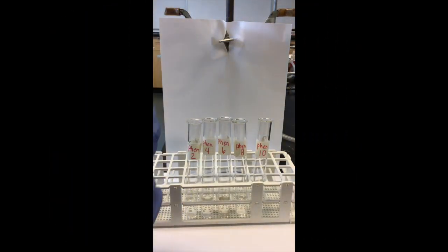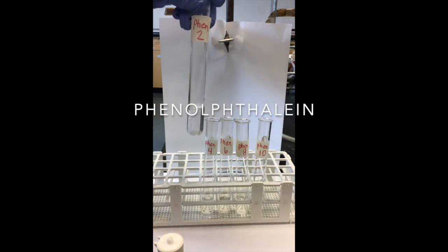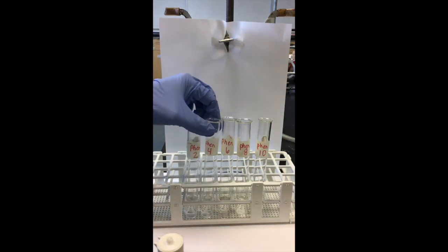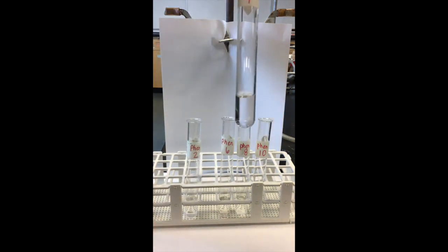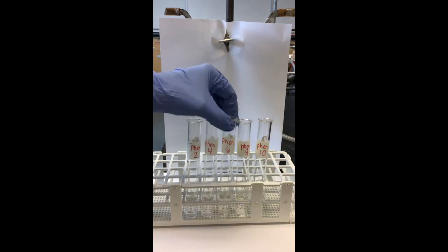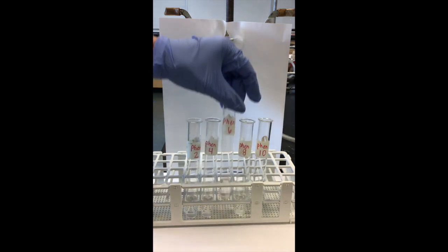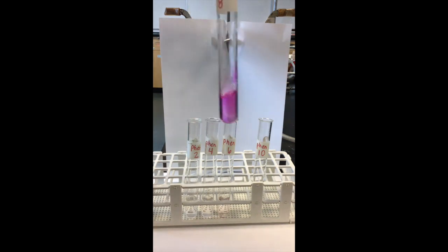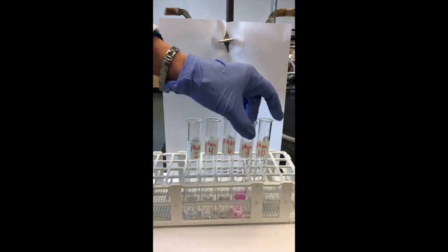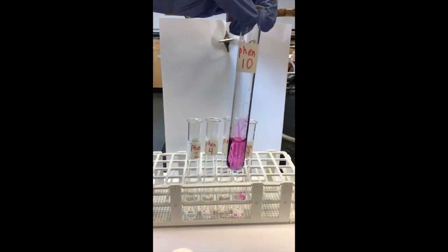Now let's test our solutions with phenolphthalein. We'll put two drops in each one of the test tubes, agitate them, and note the color. We test pH 4, pH 6, pH 8, and pH 10, recording the color for each solution.